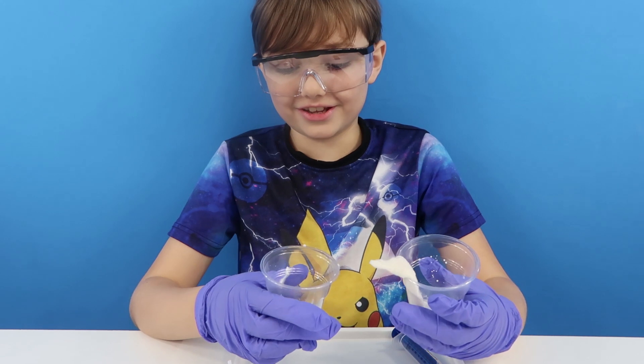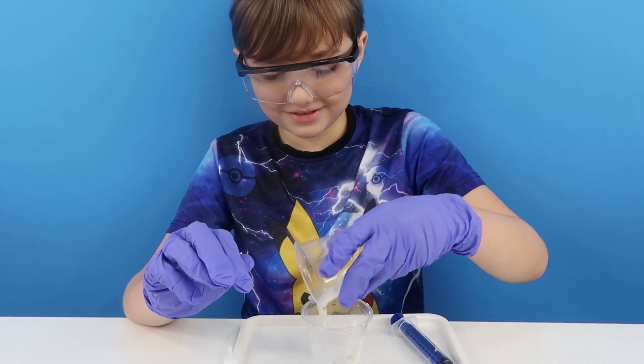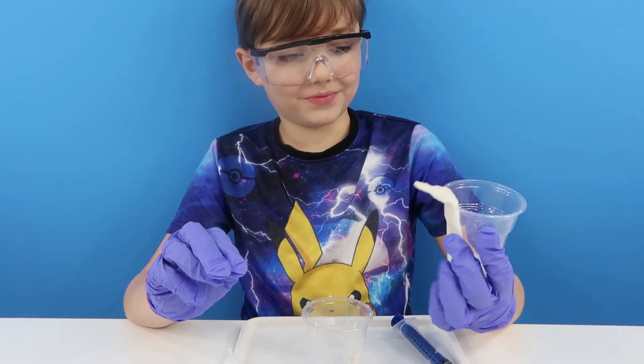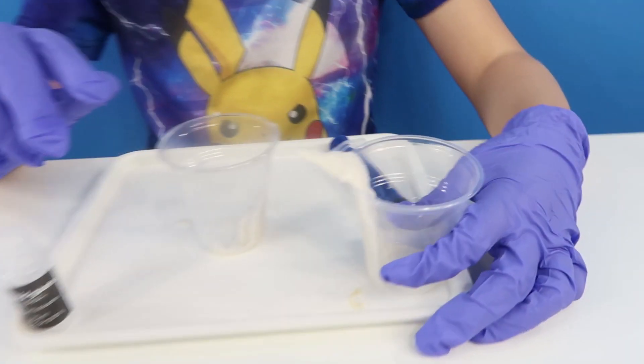It's all like stuck — like it won't move. What does it feel like? Slippery. Yeah — cool, how good was that? Awesome, that was a cool reaction wasn't it? Yeah look, it's just floating. Like something — yeah, it's just floating.